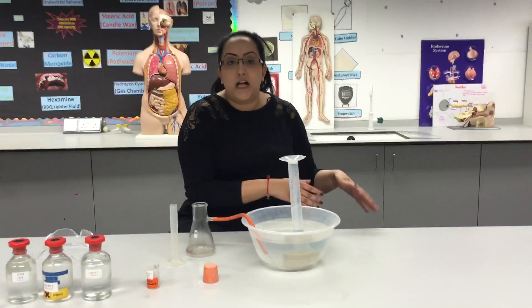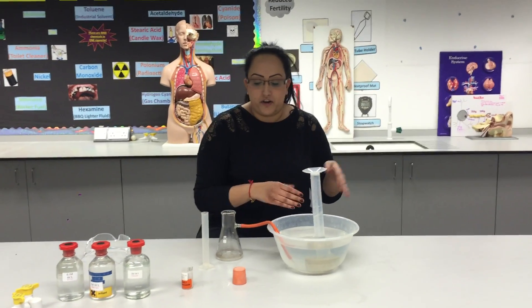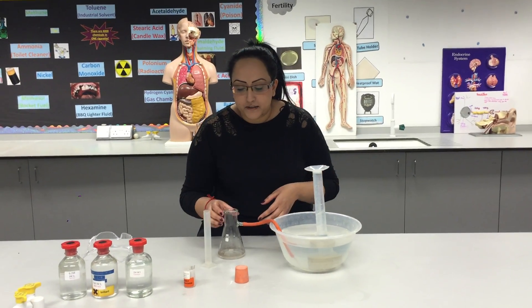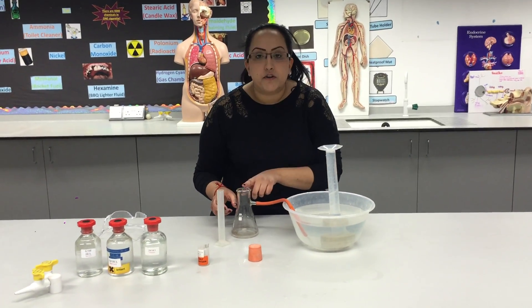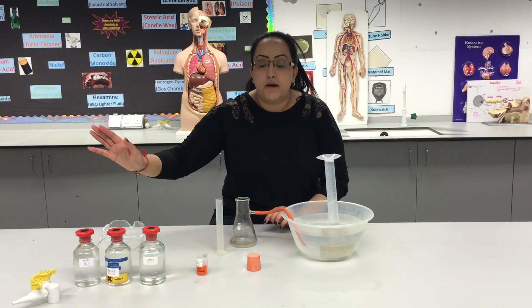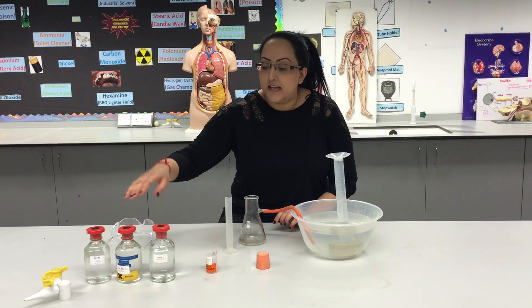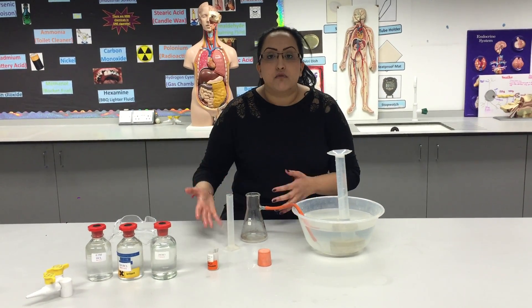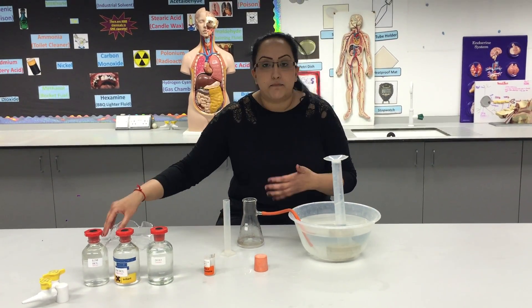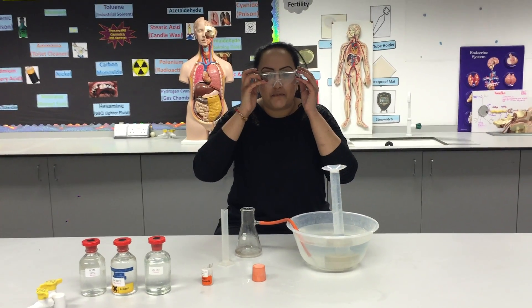You will have somebody helping you so don't worry about it knocking over. In this conical flask we're going to use three different concentrations of acid. Acid is corrosive so we need to take precautions — make sure your goggles are on.